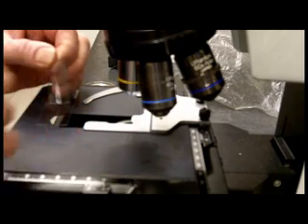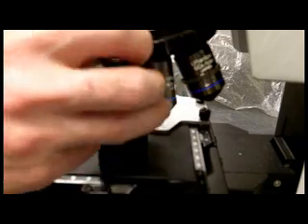When looking at the slide underneath the microscope, I use mounting fluid. You can use just clear 85% lactic acid.